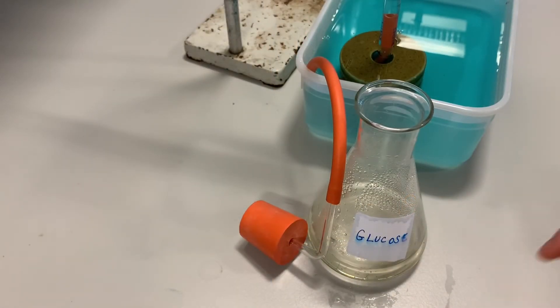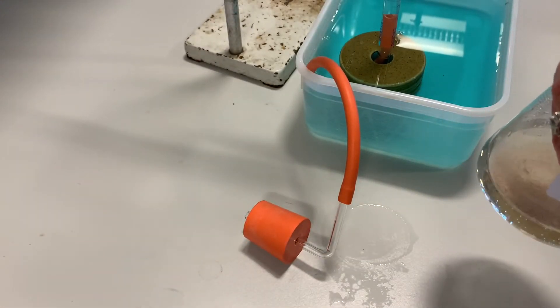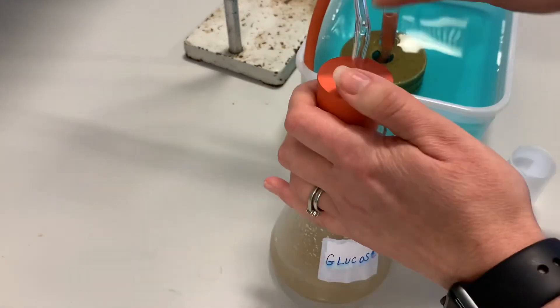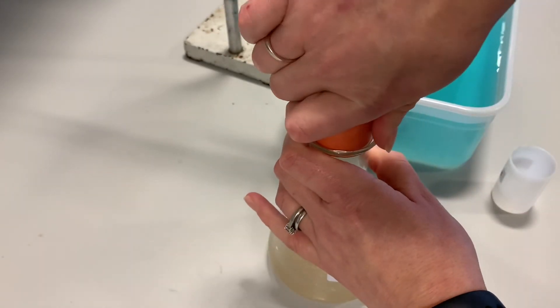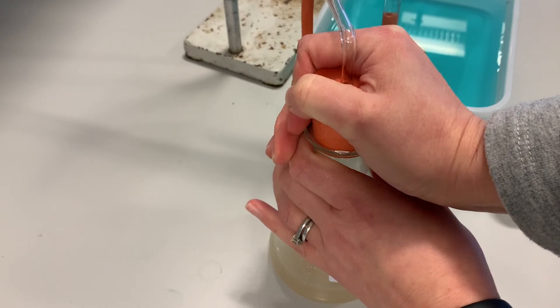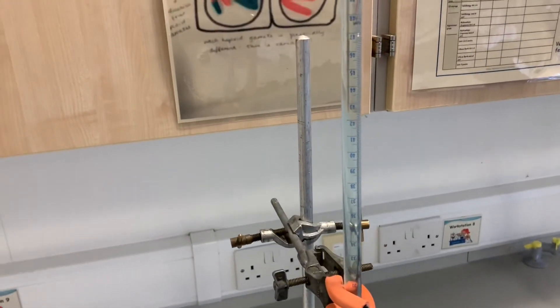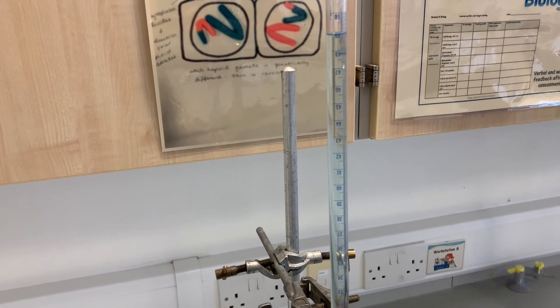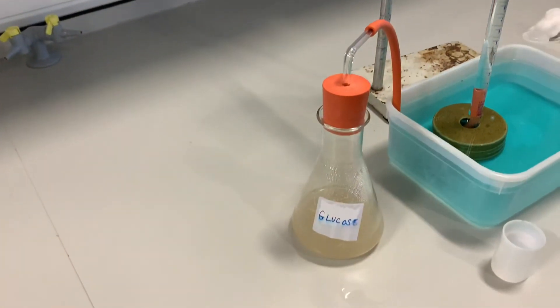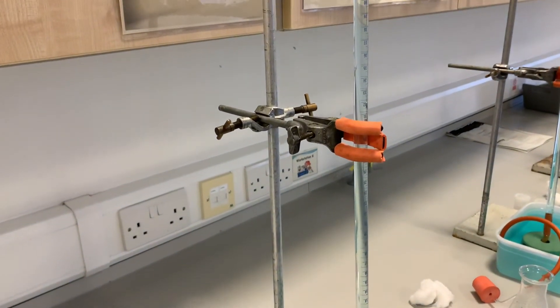We have our glucose solution, and I'm going to add some dried yeast to that glucose solution, give it a little swirl around to mix it, and then pop the bung in, which is going to trap any gas into our beaker. If we have a look at the top of our line, it's currently sitting at a reading of 49, so I know that's my starting volume. I'm going to set the others up in exactly the same way, and as the yeast start to respire and produce carbon dioxide, you can see a little bubble of gas popping up there.